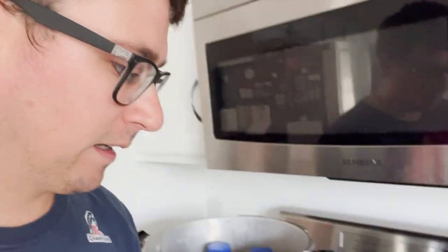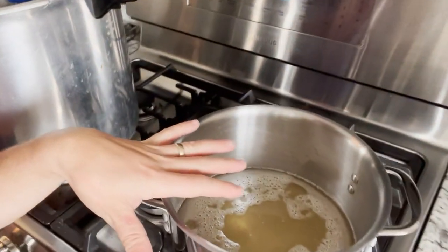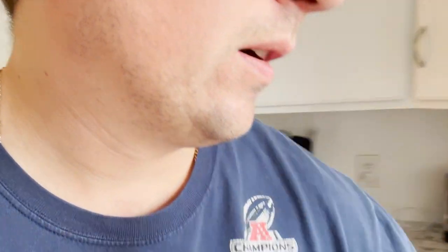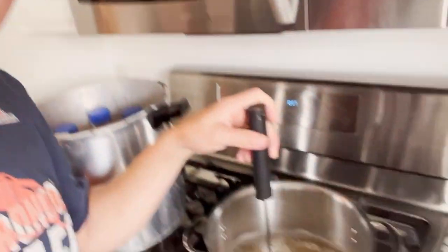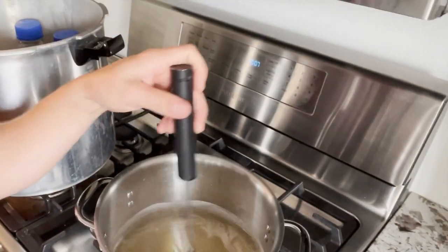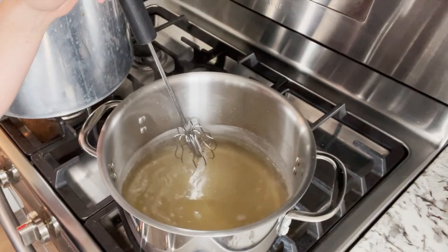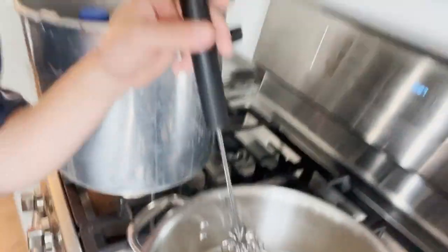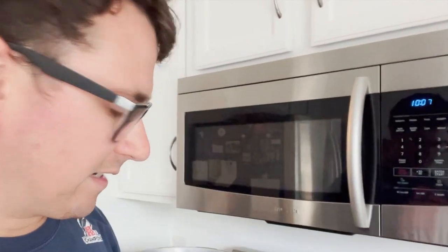Make sure that your pouring vessel is clean, make sure that the pot that you're boiling the agar is clean, and another really important tip is to make sure that it's completely dissolved. So a lot of people won't go through the extra two or three minutes to dissolve that agar, and what will happen is as it's cooking it'll cook unevenly and that could cause some caramelization problems.